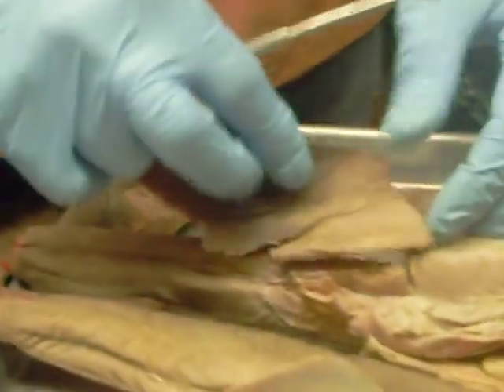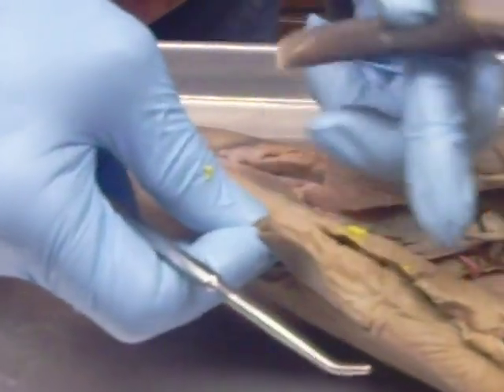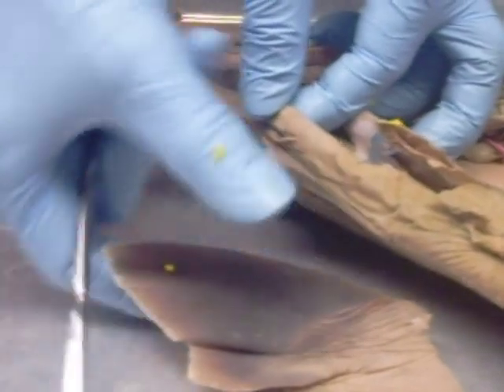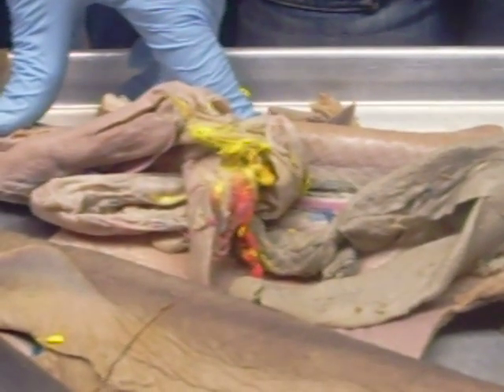Does anybody have any questions about the shark? The other one is a female, even though the fins have been removed — there are no claspers on the fins. This is a clasper — that's a male. Here's a female. Notice how she has this big fin here with no clasper on it. The gonad over here is going to be the ovary — it's going to look very similar. If you see there are no claspers, when you see the gonads it's an ovary. If it has claspers, you see the gonads, it's a testis.